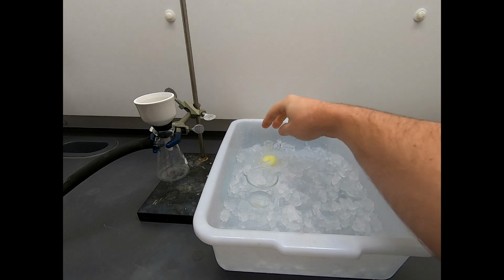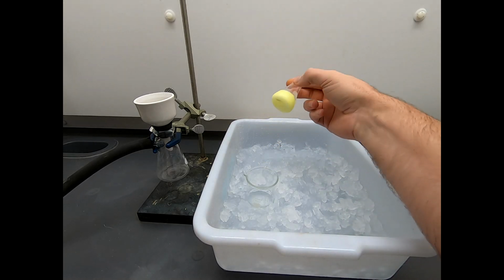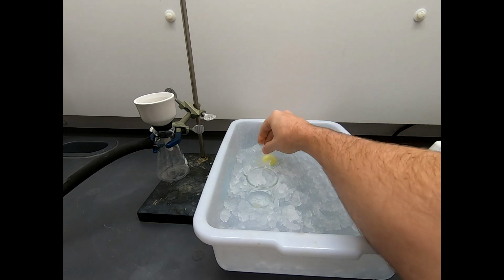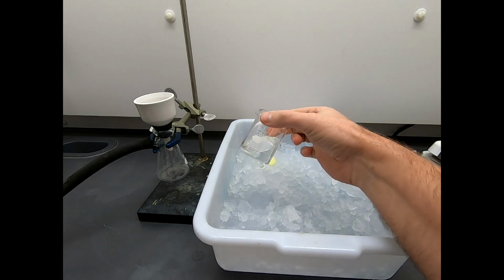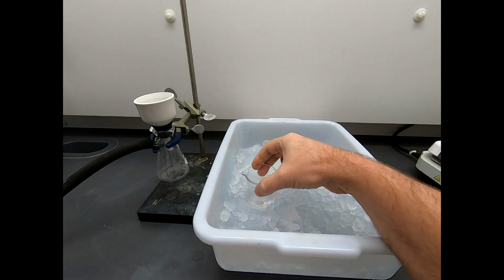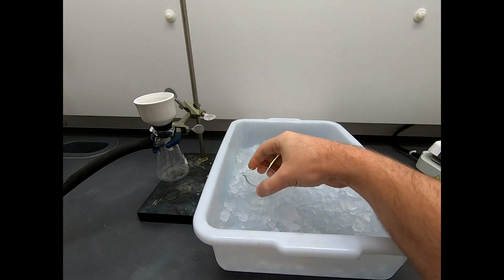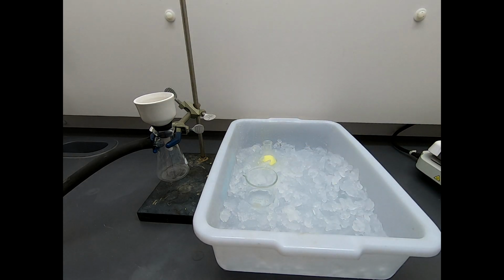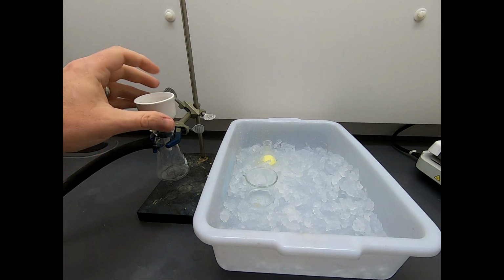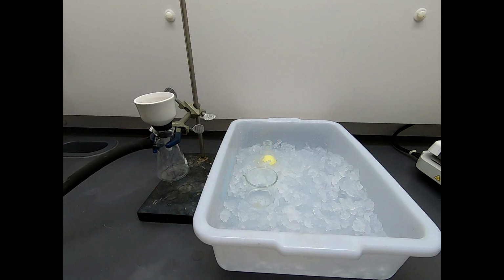Well, everything has cooled down, so I have on ice our solidified product. That's not all solid. Remember, there's ethanol in there. There's some water in there, and we have some cold ethanol water. This is about a 30% water, 70% ethanol. I tried to dilute the ethanol with some water in a similar proportion to what we used with our crude product for our recrystallization. And then of course we have a Buchner funnel, and we're going to filter this solid. So let's go ahead and make sure everything's set up with our vacuum and our trap.